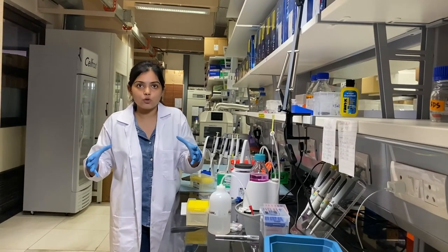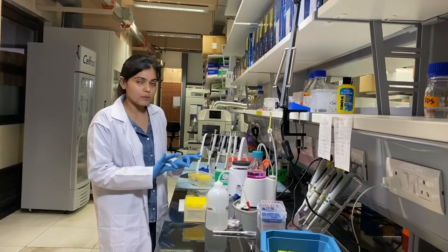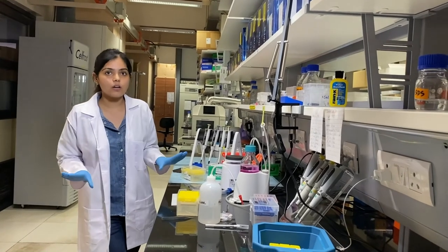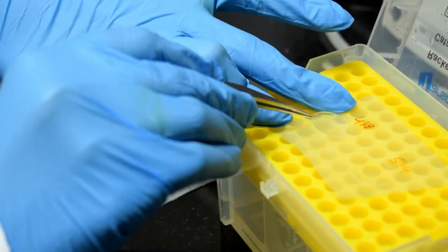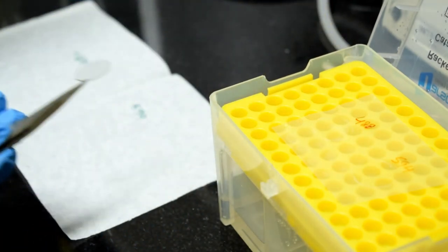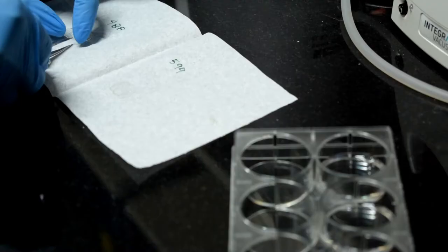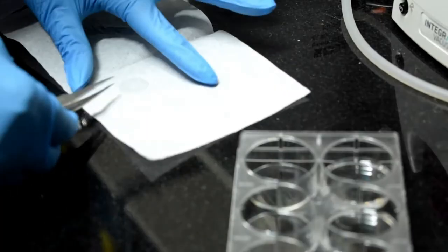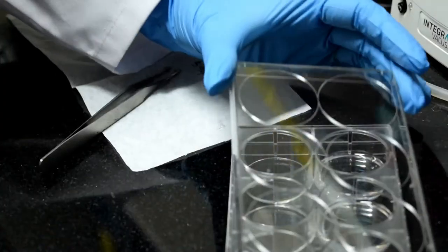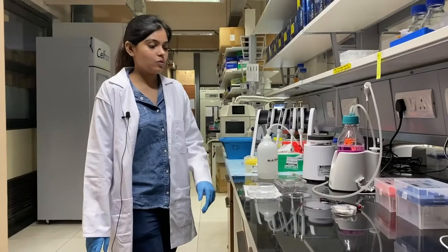We want even expansion of the whole sample. To achieve this, we put the gels in a homogenization mixture and place them at 70 degrees Celsius for one hour. I'm gently removing the solidified gels and placing them into this six-well plate containing the homogenization mixture, and then keeping it at 70 degrees for one hour.